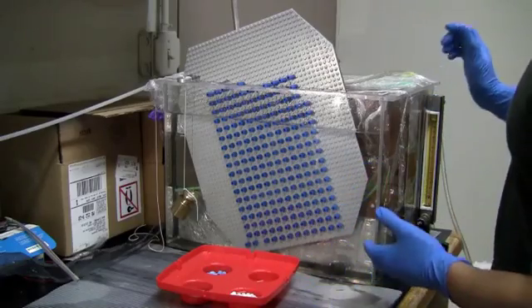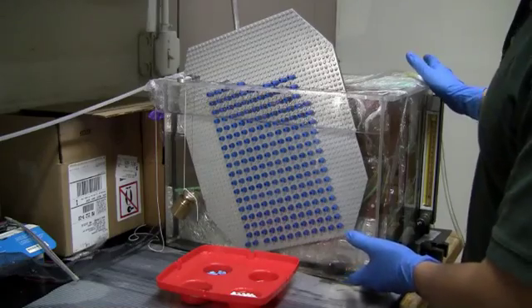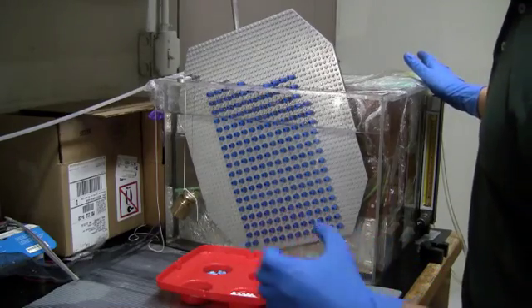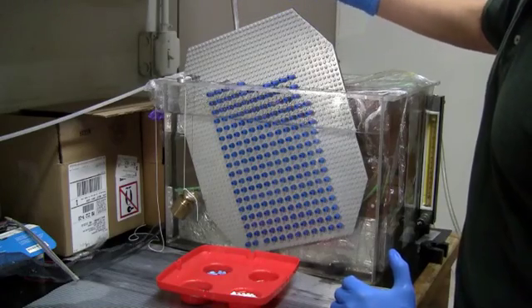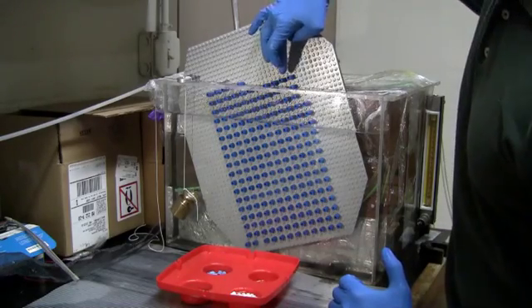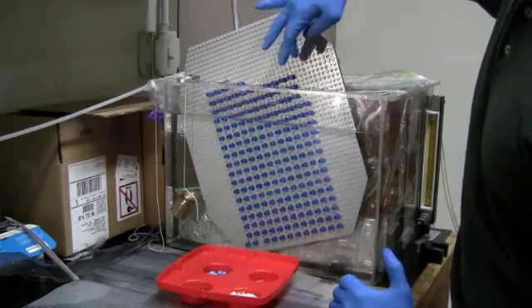Here's our setup. Here we have our tank, something you can buy at a local pet store, like a little aquarium. Here we have our Lego board, a Lego board you can purchase at any toy store, with our Lego pegs that act as our obstacles.